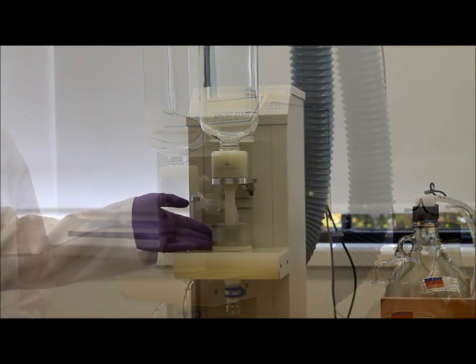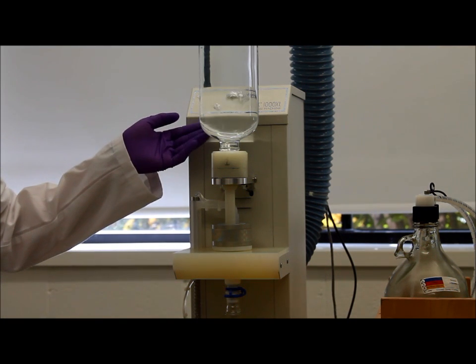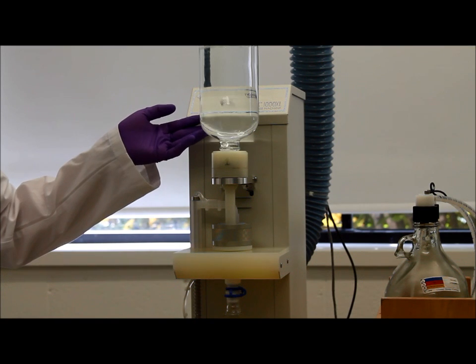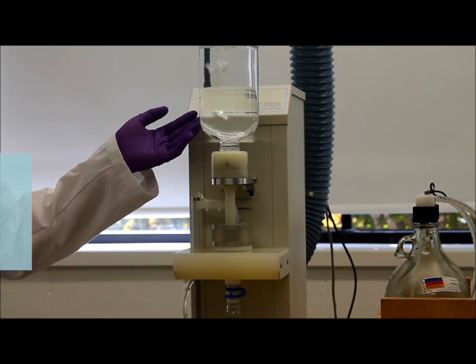Once the disc has done pre-conditioning, the sample will begin to process. This process takes about a couple minutes depending on how dirty your sample is.